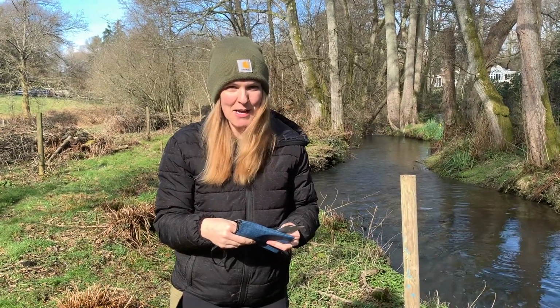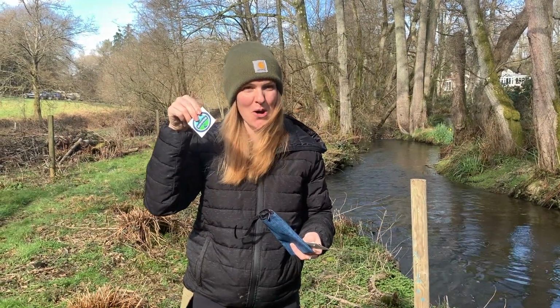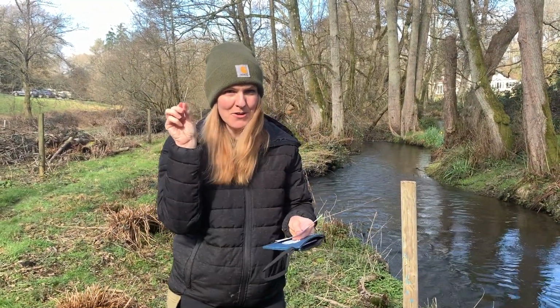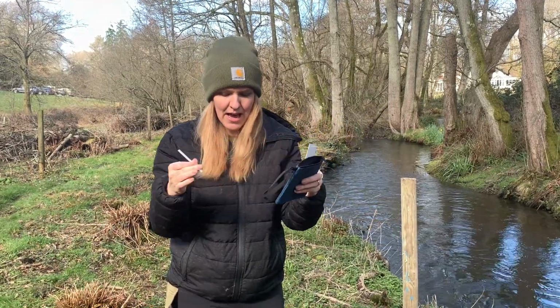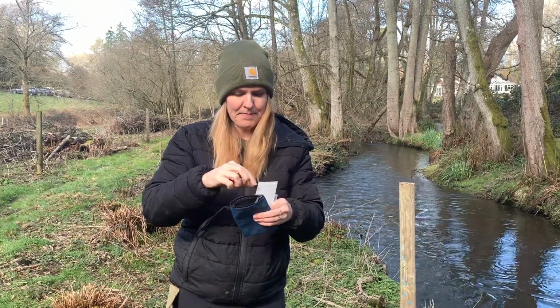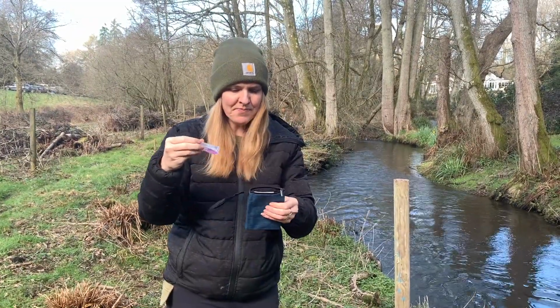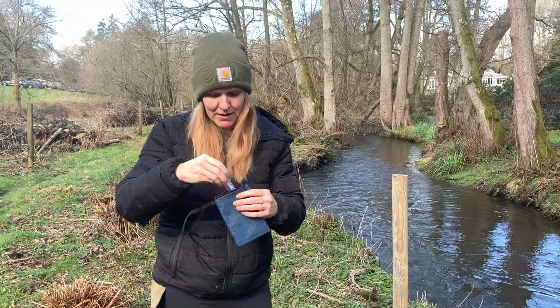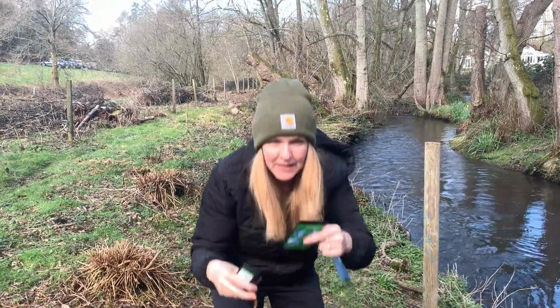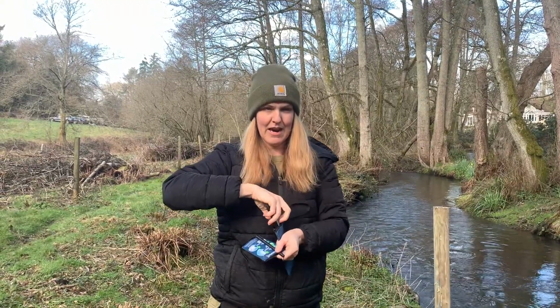Once you're finished, it's time to pack up your test kit. You'll notice you have a sticker. You are now officially a water ranger. You're trained up, done your first test. Do not put your test strip or these things back in the containers that you had them. You can put them in your little baggie as long as you keep everything sort of separate from those things that need to stay dry. Sometimes I just put these in my pocket, but you can put them in here just as long as you make sure that this is sealed. You want to make sure that there's no moisture that gets in there.